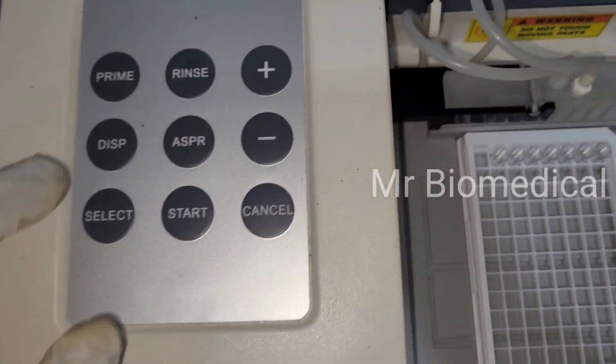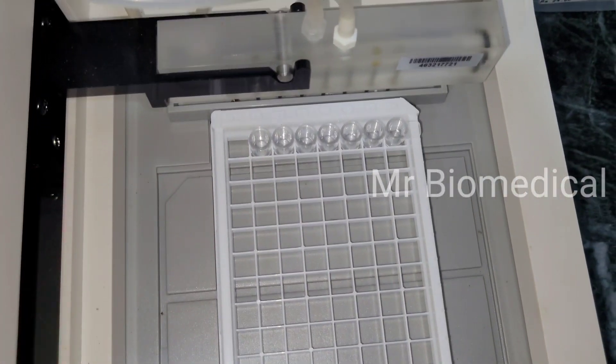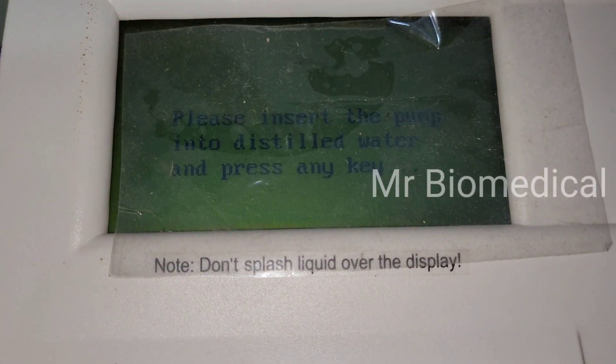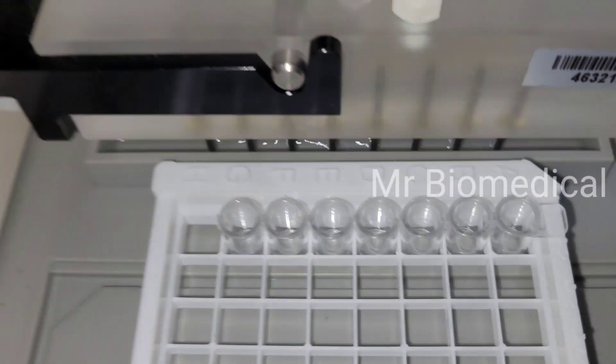And now let's check whether it is working or not. And yes, water is coming now.